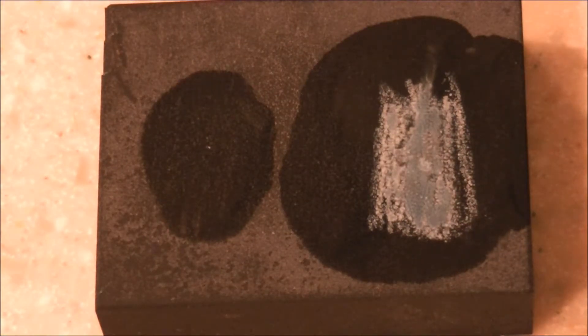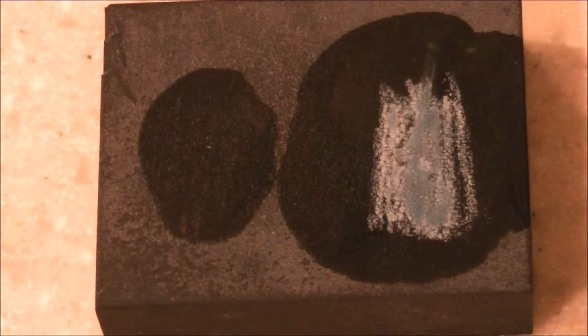On the right hand side, that's the little charm, the little 925 sterling charm — all that little silver residue, that's the silver left over. It's been burnt, burned away all the extra impurities. The one on the left, that is the zinc scratch. It's gone completely. I'm going to rinse the stone off, bring it back over, scratch the same ones again, and show you what's going on with them so we'll see the actual reaction happen in real time.